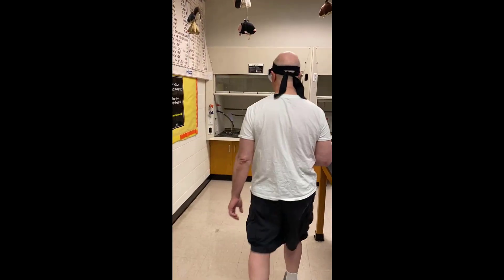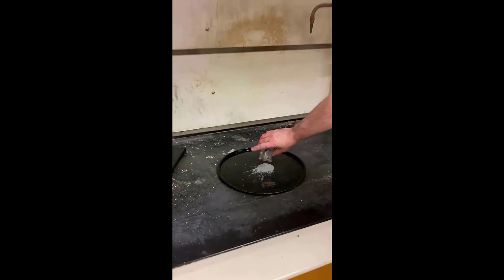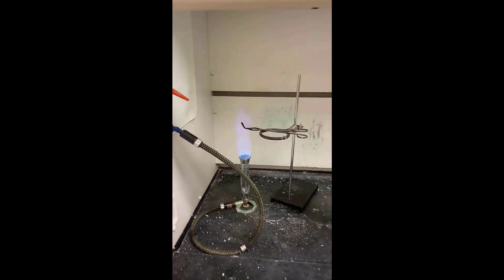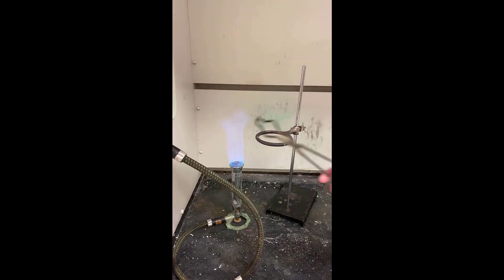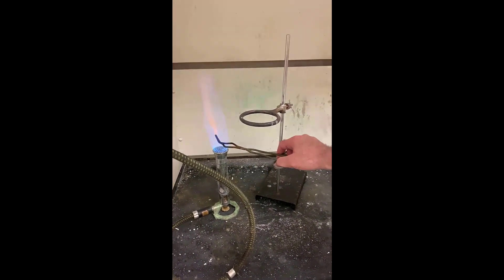Let's come over to the hood. I'm going to put this right here. What we're going to do is increase the temperature of that by a lot by putting a red hot piece of iron on top of it. I'm going to put it on top of the zinc and sulfur and see if anything interesting happens. I should have done that in slow-mo.